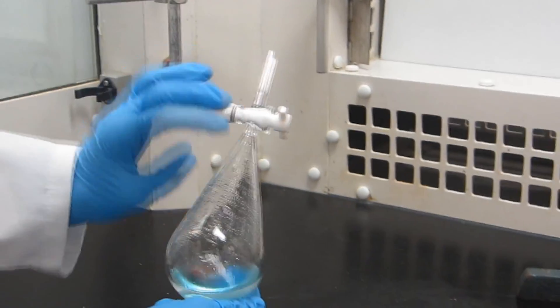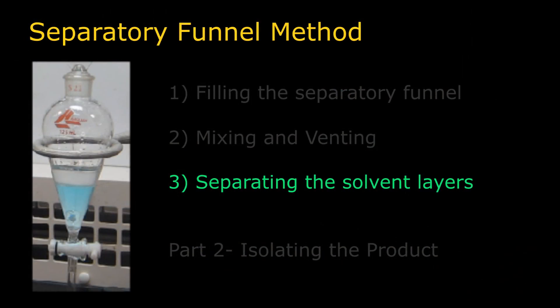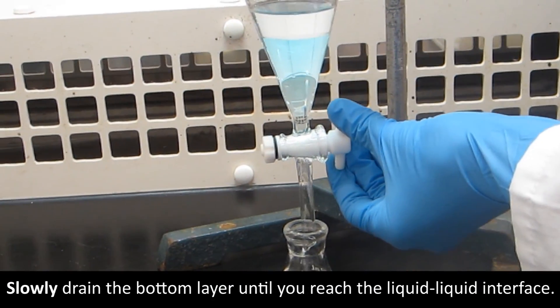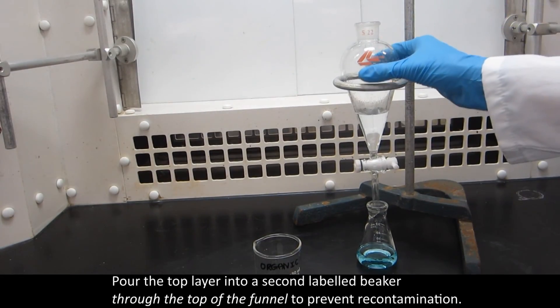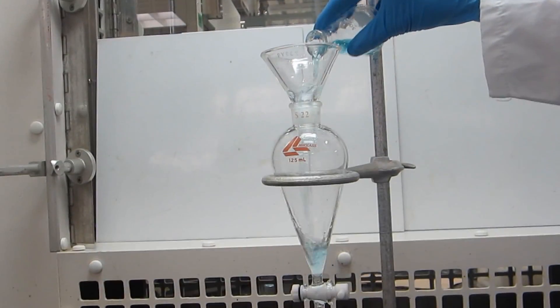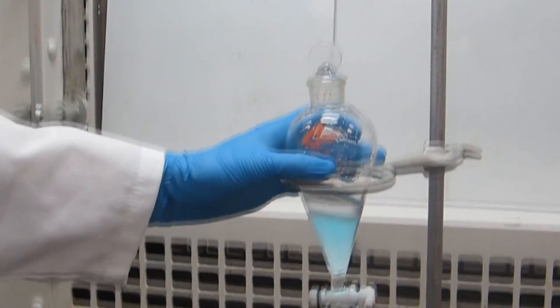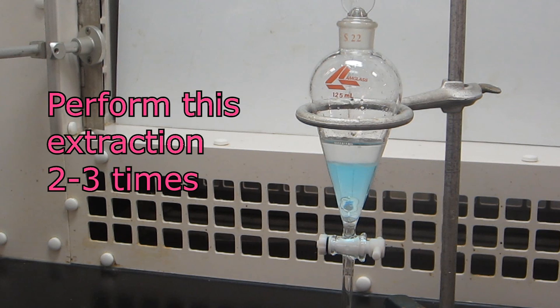When finished, close the stopcock and return the funnel to the ring stand so the layers can separate. Separating the solvent layers: To begin separating the layers, place a labeled flask underneath the funnel tip. Remove the stopper to allow the liquid to drain well. Slowly drain the bottom layer until you reach the liquid-liquid interface and close the stopcock. If you are done with the top layer, pick up the funnel and pour the top layer into a second labeled beaker through the top of the funnel to prevent recontamination. Return the aqueous phase back into the separatory funnel and pour in a second volume of organic solvent. Repeat the shake and vent technique and separate the two layers again. Performing this extraction two to three times is usually enough to fully extract your desired organic material from the aqueous layer.